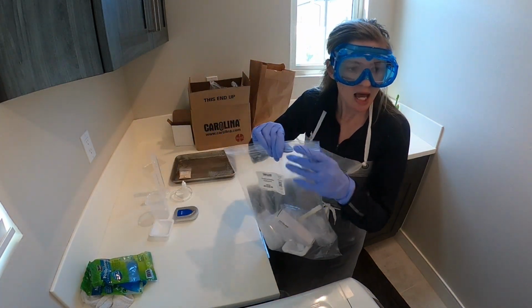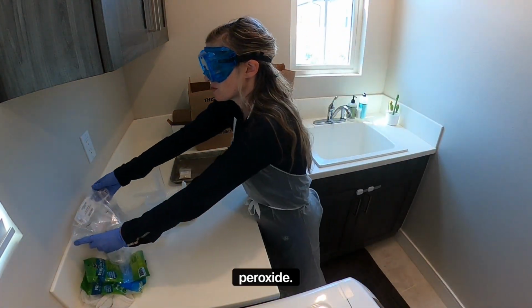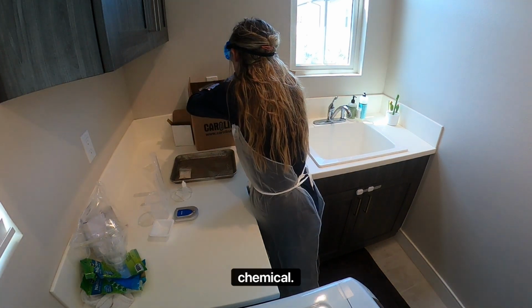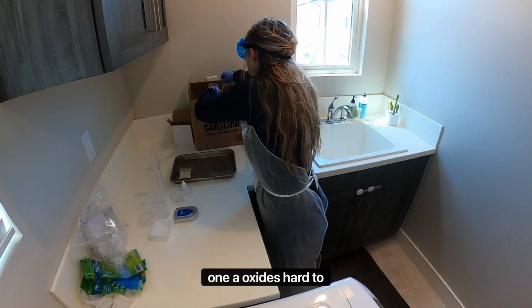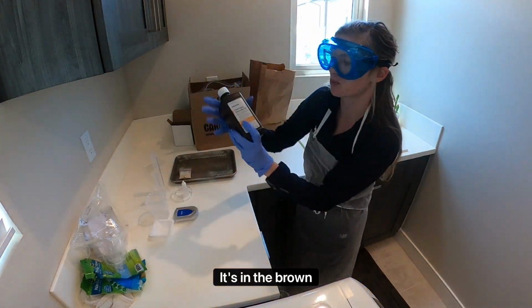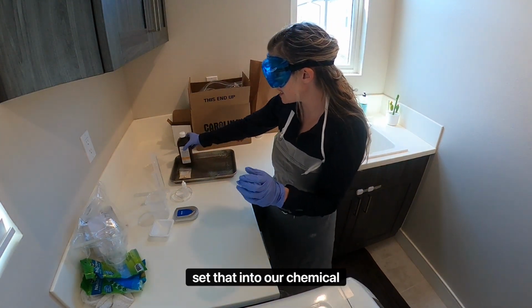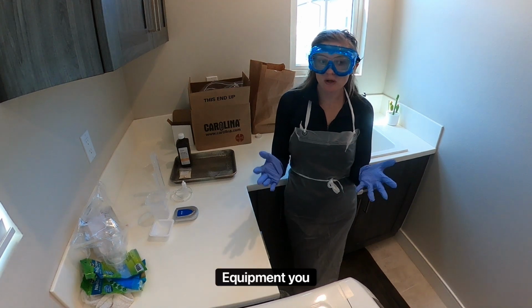The last thing that you're gonna need is hydrogen peroxide. This is actually in your chemistry chemical set 1. The hydrogen peroxide is hard to miss. It's in the brown bottle. So we're also gonna need the hydrogen peroxide, and we're gonna go ahead and set that into our chemical tray. So that's all of the equipment you need.